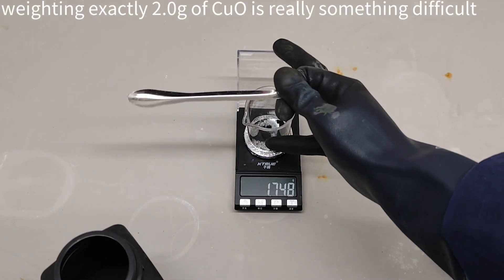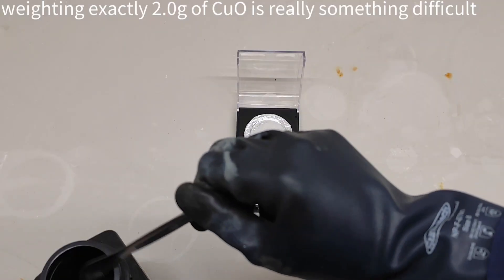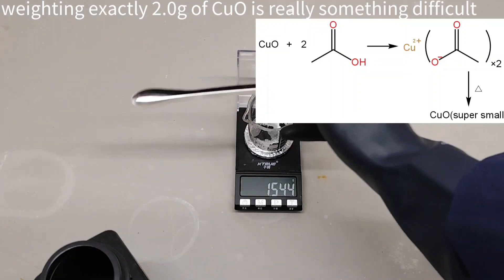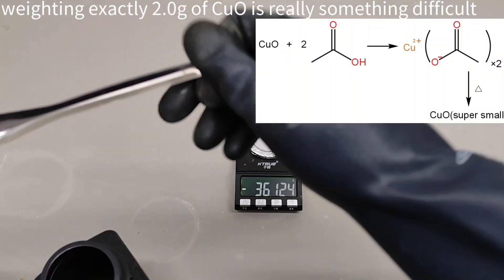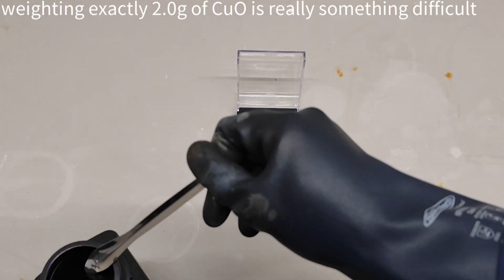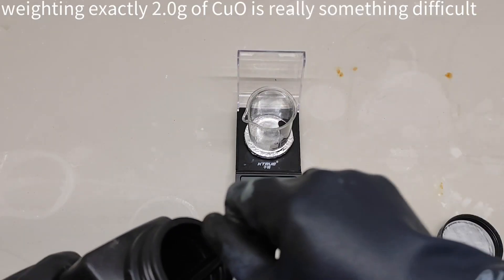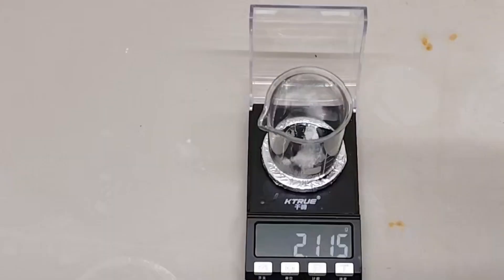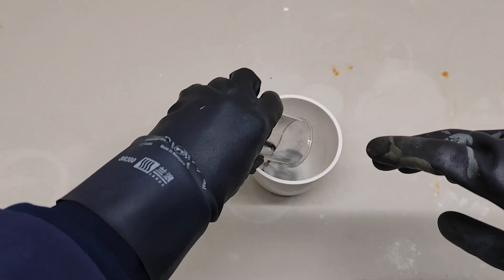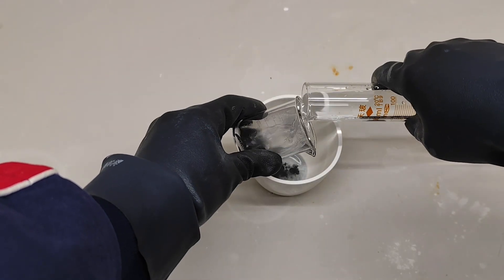Now it is time to make the copper catalyst. It is not recommended to use copper oxide powder directly, because its surface area is too small. Instead, it is better to convert it into copper acetate, then heat it to reduce it into very fine copper oxide powder with a much larger surface area. I weighed about 2 grams of copper oxide and 3 grams of pure acetic acid, and poured them into a cup with a few milliliters of water. You can also use a solution, but that is not recommended because it introduces too much water.